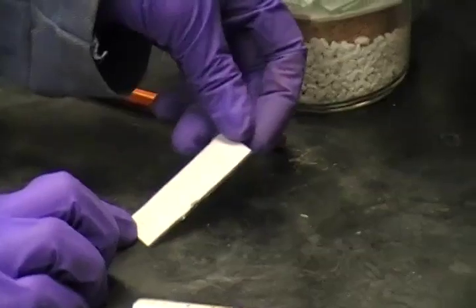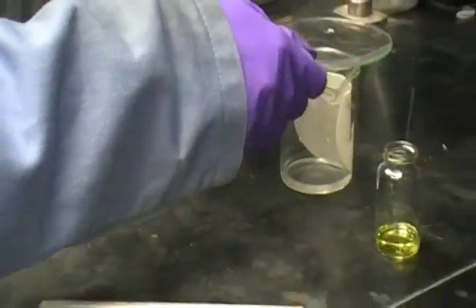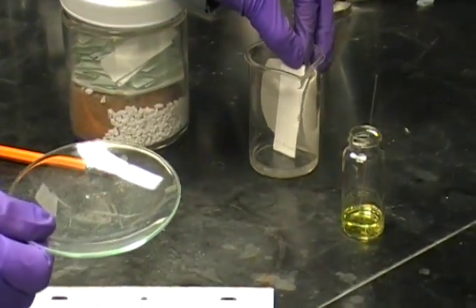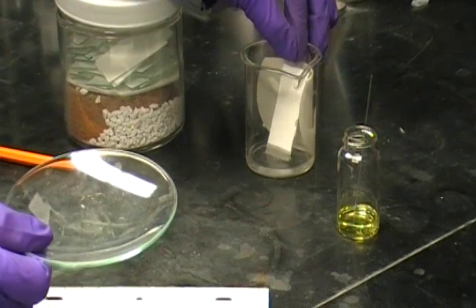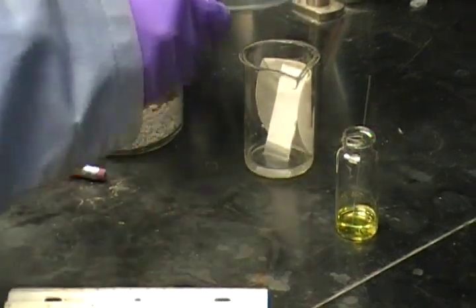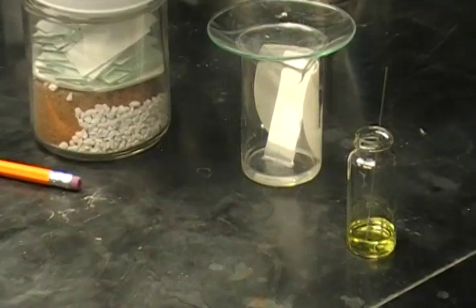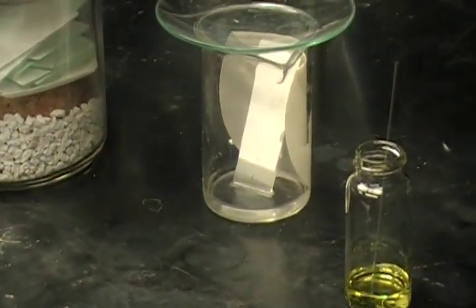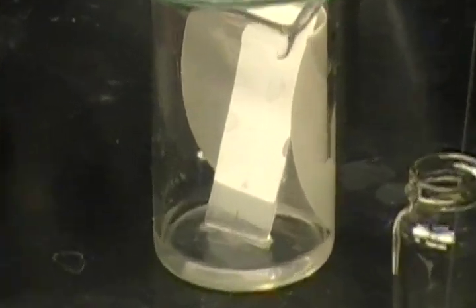After the sample has dried on the TLC plate, we place it into the TLC developing jar, being careful not to have the solvent line in the jar go higher than the line drawn on the plate. In this developing jar, we have hexanes, a non-polar solvent.